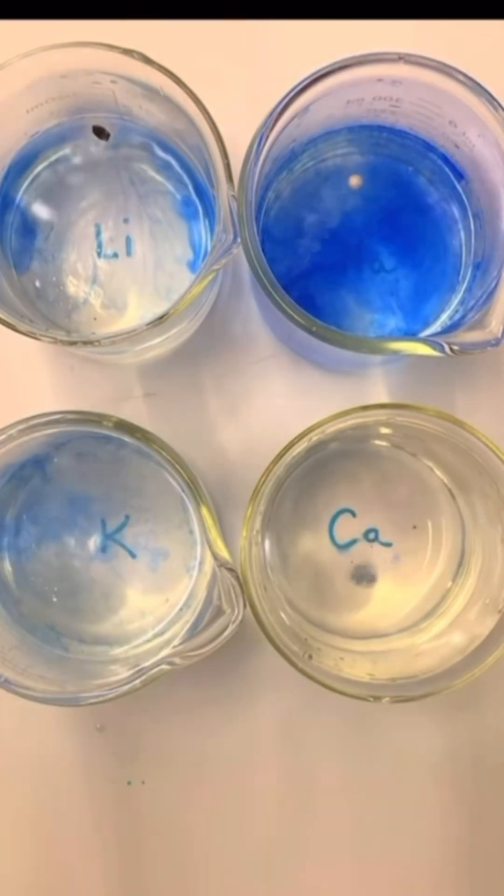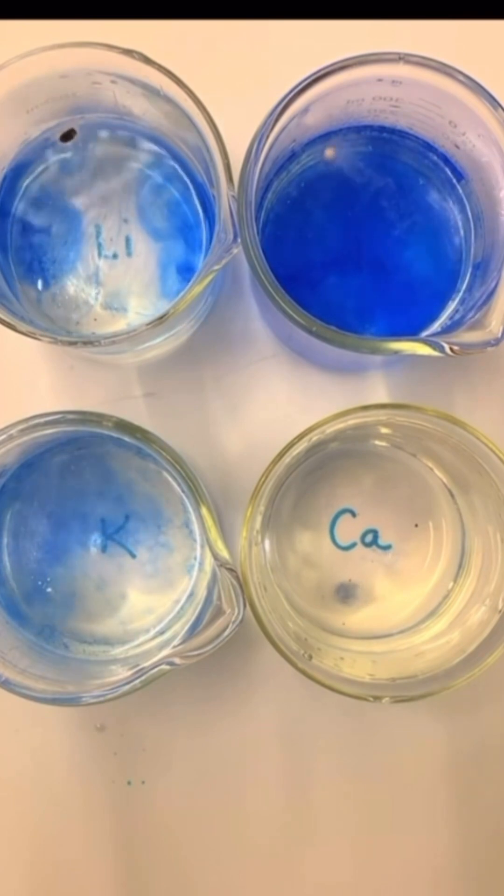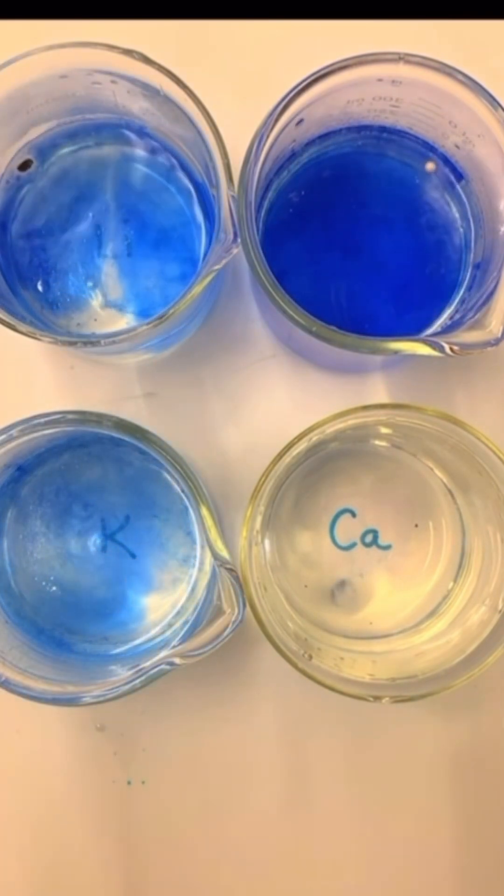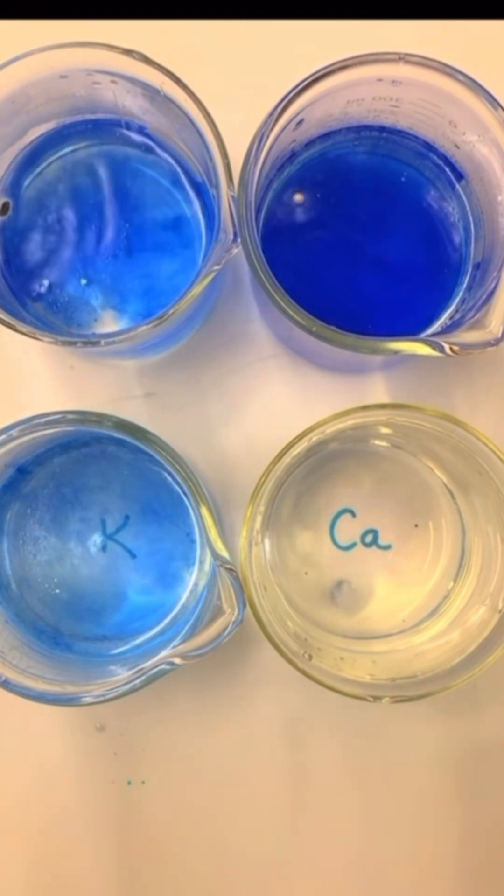Now, potassium. This one reacts explosively, even catching fire. The result is potassium hydroxide, another alkaline solution turning the indicator blue.